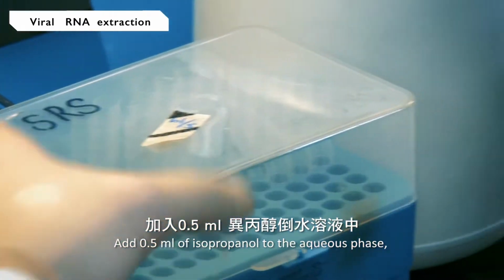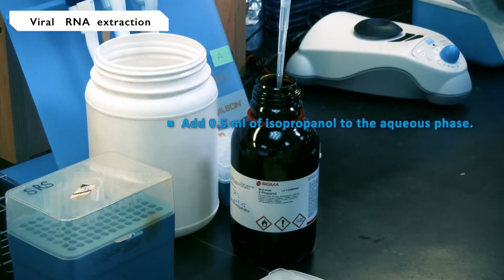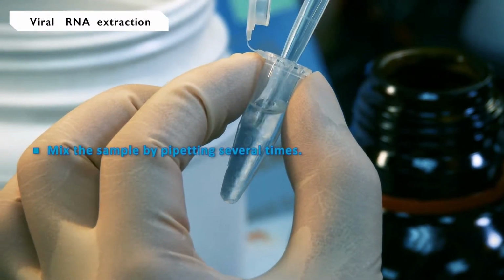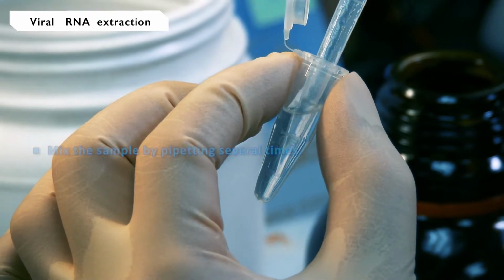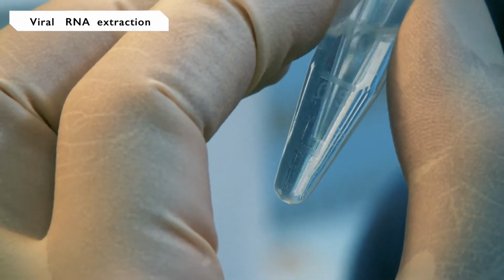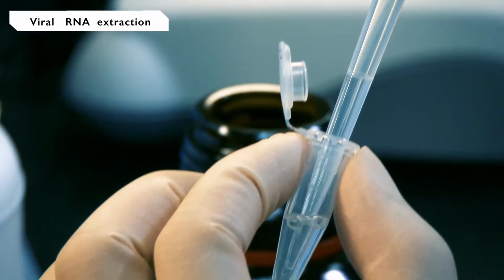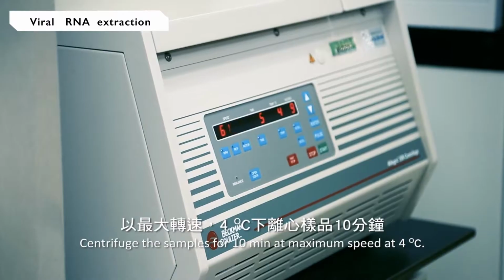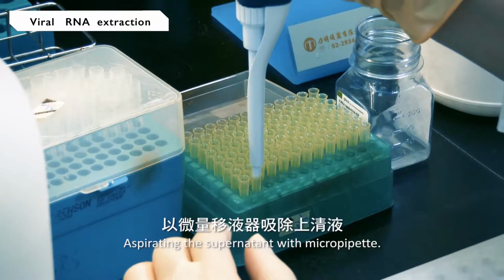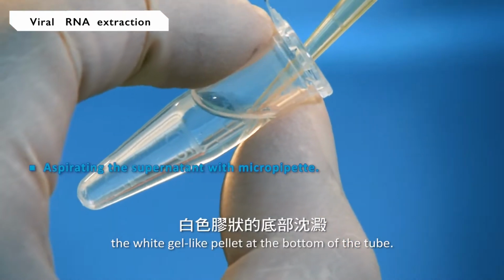Add 0.5 milliliter of isopropanol to the aqueous phase, and then mix the sample by pipetting several times. Incubate for 10 minutes at room temperature. Centrifuge the samples for 10 minutes at maximum speed at 4 degrees Celsius. Aspirate the supernatant with a micropipette, and avoid contacting the white gel-like pellet at the bottom of the tube.